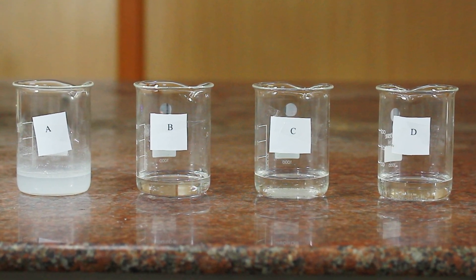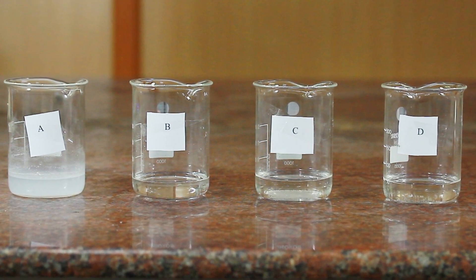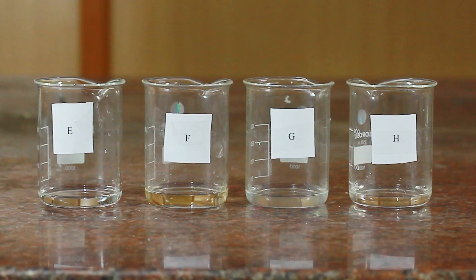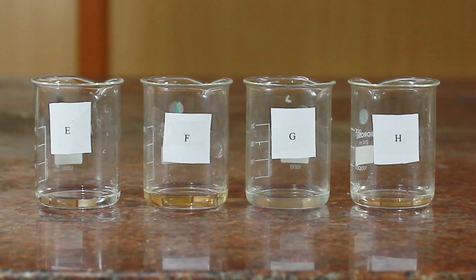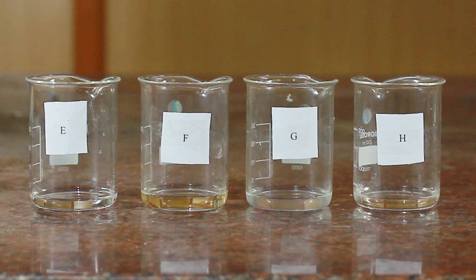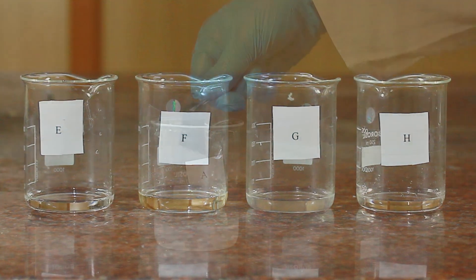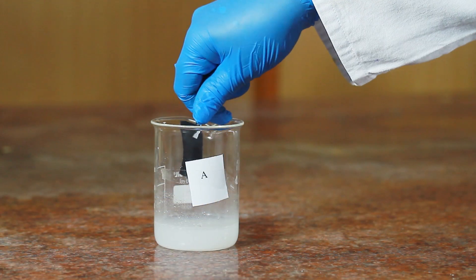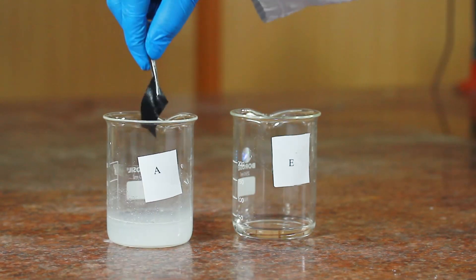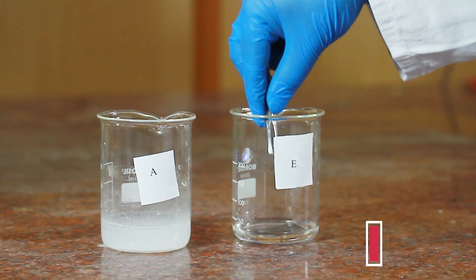Procedure: Place about 50 ml of five percent solution of each of the four given samples of chemicals in four beakers and label them as A, B, C, and D. Place about 20 ml of dilute sulfuric acid in each of the remaining four beakers and label them as E, F, G, and H. Dip a small piece of black cloth in beaker A, pick the cloth out and dip it in dilute sulfuric acid in beaker E.